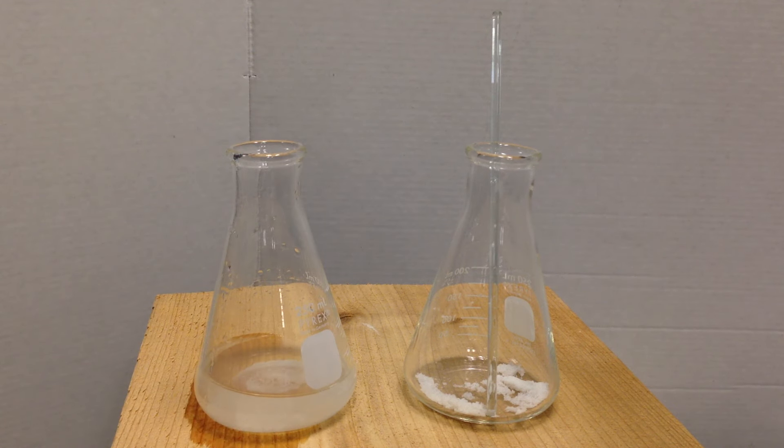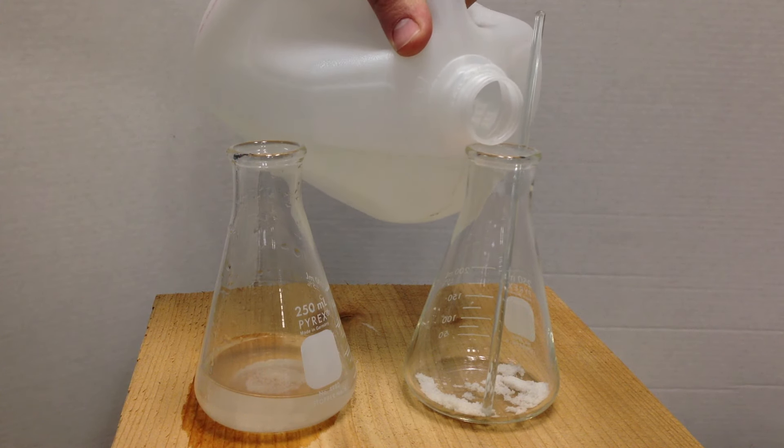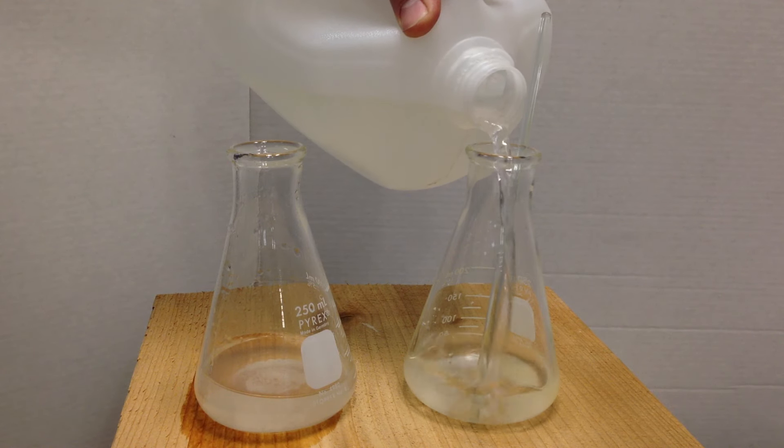And same thing with the potassium iodide. Hopefully it won't make as much of a mess. It's the KI, adding some water. Also making an aqueous solution.